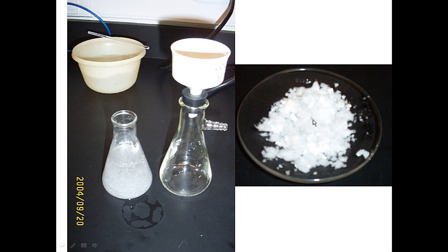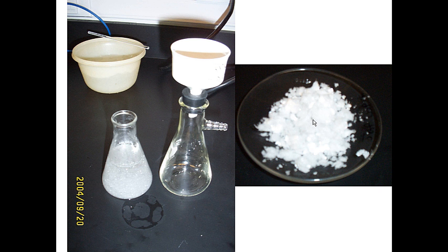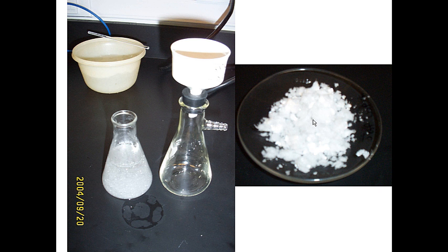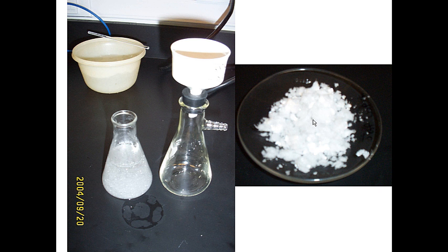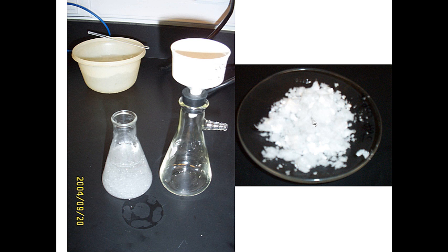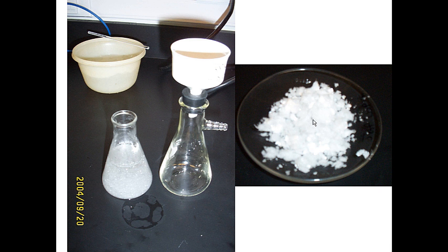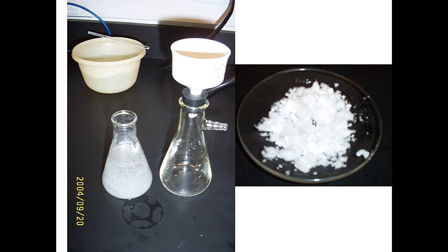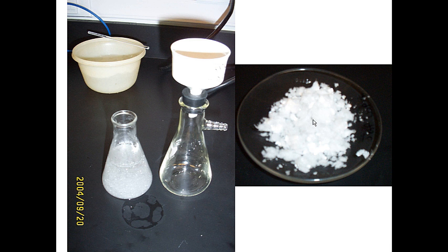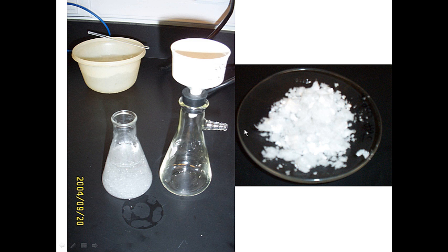Appearance is always a qualitative test of purity, so we can see how much we've qualitatively purified the material just by looking at it. Acetanilide should be a colorless solid, so if it still has a gray to brownish color, that means there are still some impurities present. When it's done it should be a colorless solid.